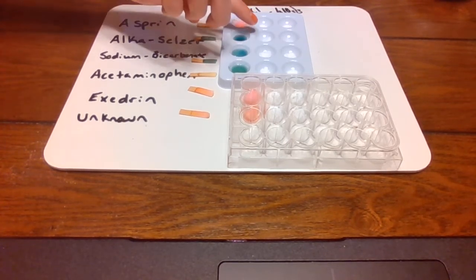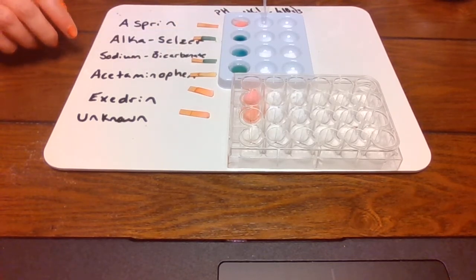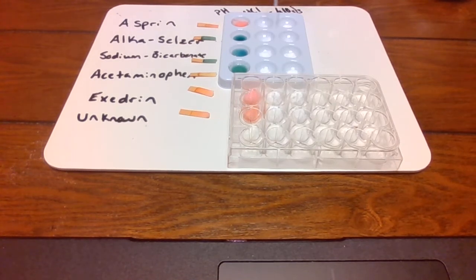So right here, just put one to two drops. Keep putting it. Don't be afraid of it. Push it till you can see some liquid. There you go. Next one. Oh, that one's having a reaction. Oh! Fizzing. Oh, a little bit of fizzing. Whoa, a lot of fizzing.